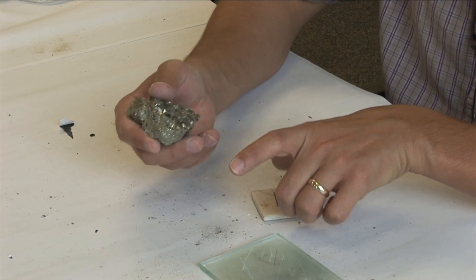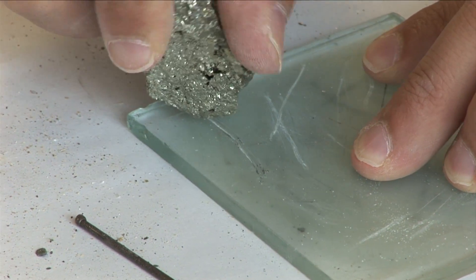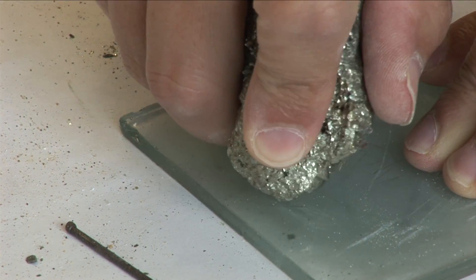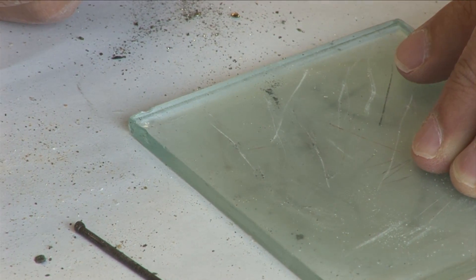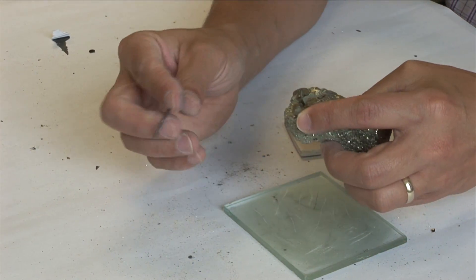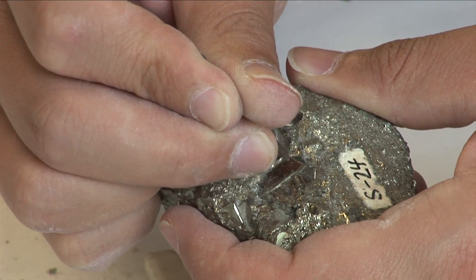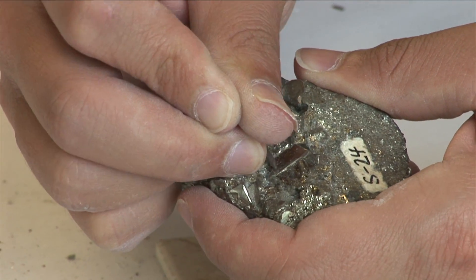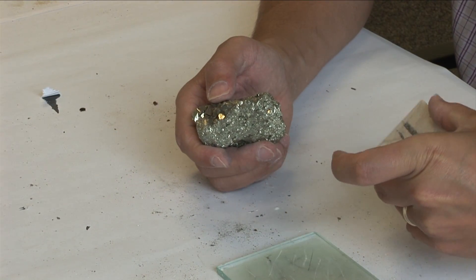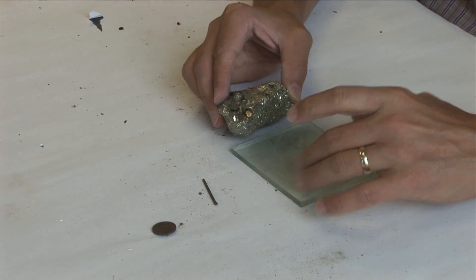Let's check for hardness. Start with glass, which has a hardness of 5.5, then we can move up or down as needed. The sample is leaving a noticeable scratch on the glass. Let's see if a nail can scratch the sample — it does not. The sample is definitely harder than the nail, so harder than 4.5. We already know the sample is softer than the tile because it left a streak. So the sample's hardness is closest to that of glass — approximately 5.5.